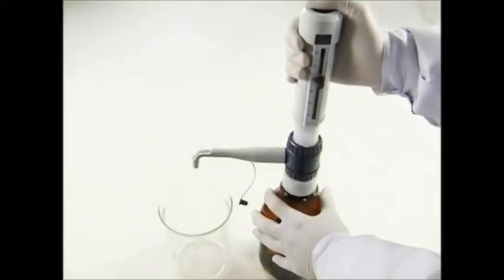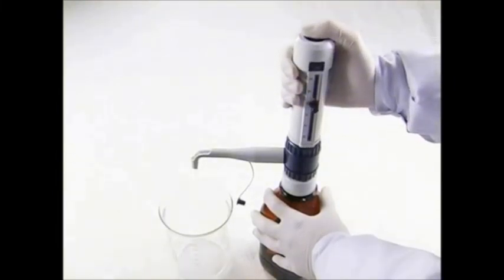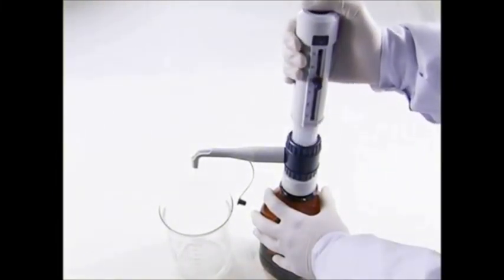Pull the piston up slowly to the upper stop, then push the piston down gently to dispense into the vessel.